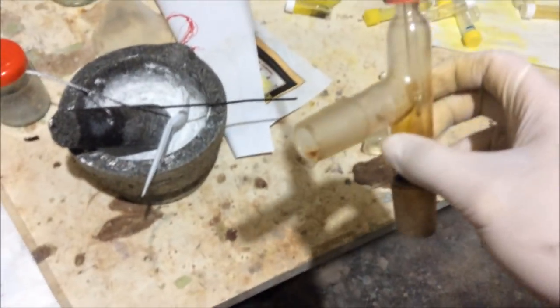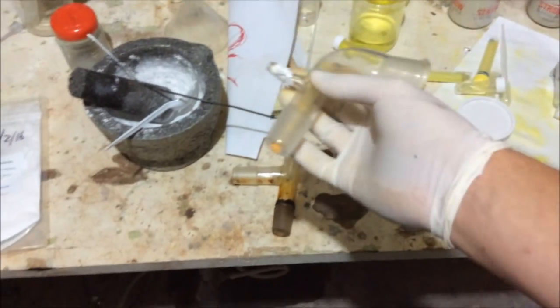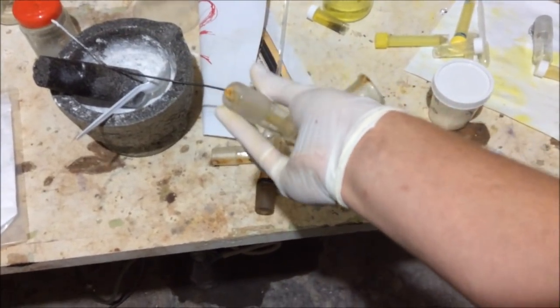I can do that now, instead of cleaning up the glassware, I can just reuse the glassware as is, because it's using the same stuff. I might have to clean all the tape off this glassware. That tape was a bad idea. Look at it, this tape just melted onto the... it worked, it did work. How bad is the idea if it works? But it smelled terrible, and I thought it was going to catch fire or clog stuff. This is all just covered in that orange solid, whatever it is, it's all solidified.